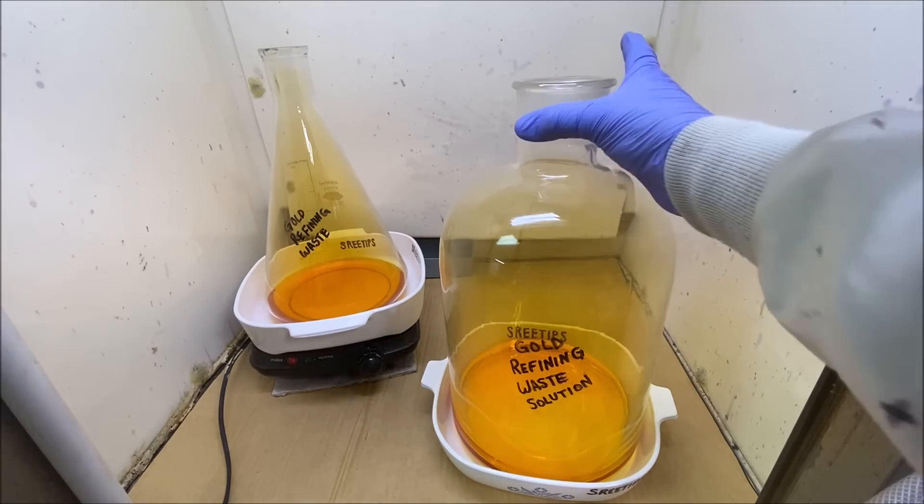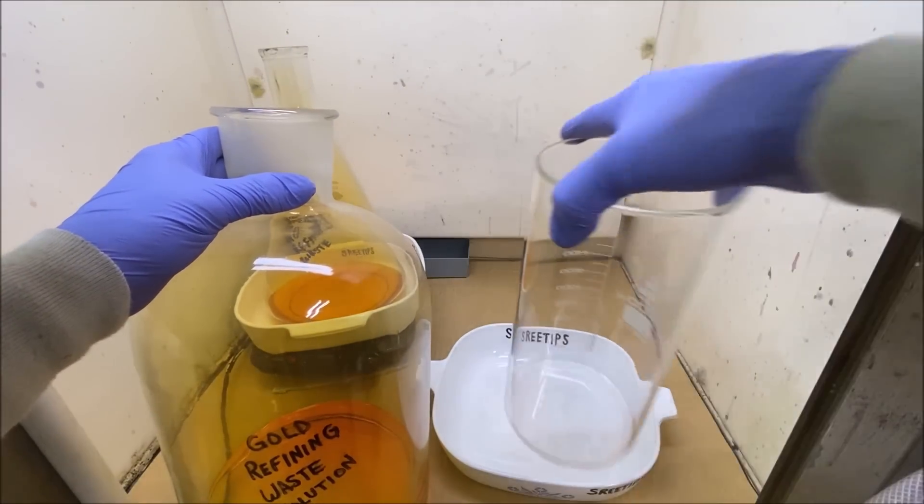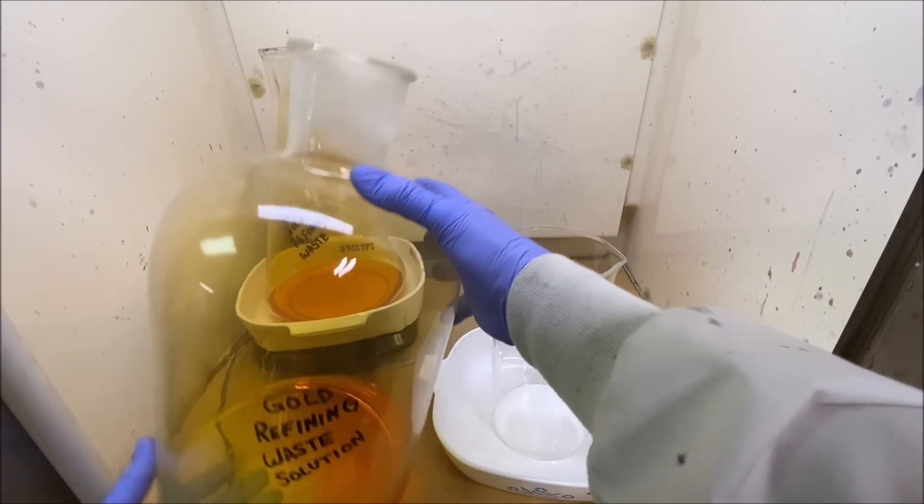All the gold is gone in solution, so now what we'll do is transfer the gold-bearing solution from each of these containers into a clean beaker.